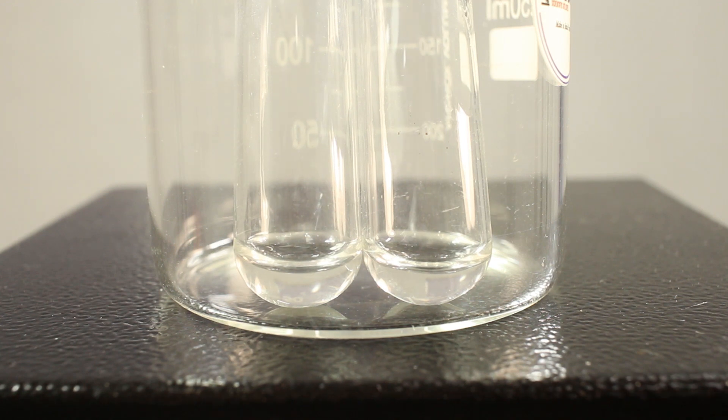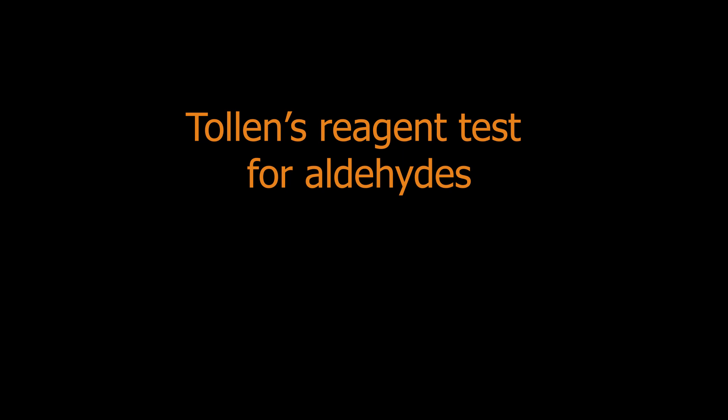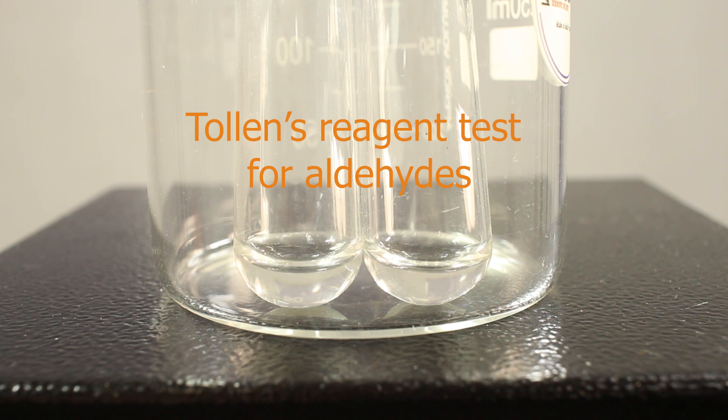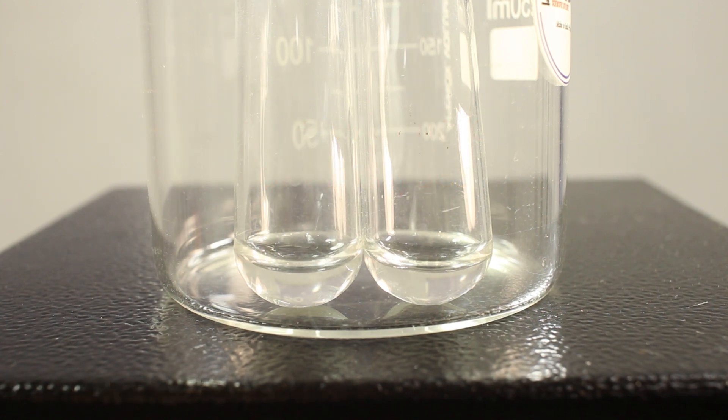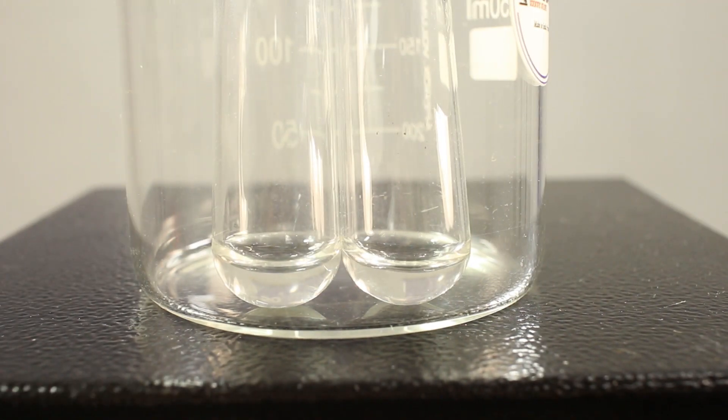We are ready for the test. OK, I'm using two test tubes and two substances, one for control: starch. Starch is not an aldehyde, not reducing, and it's not supposed to give a positive result.